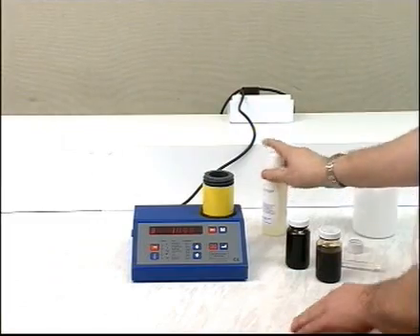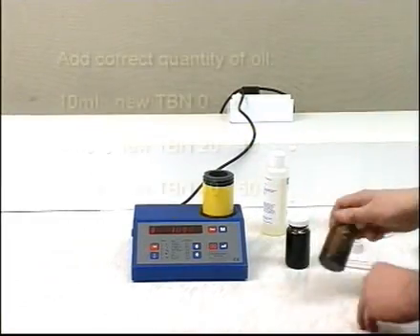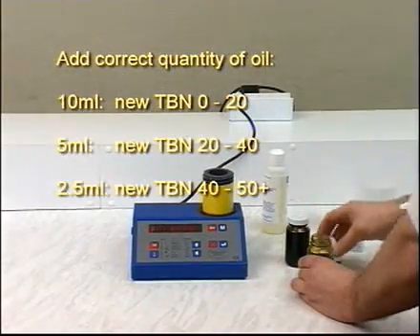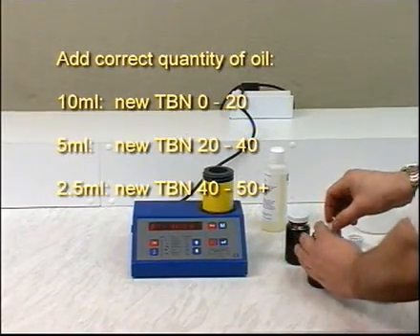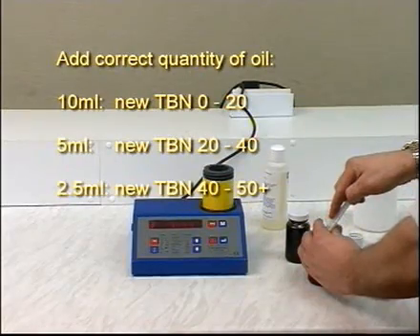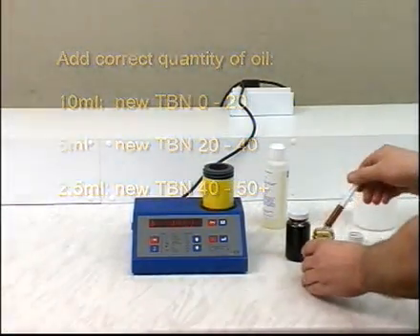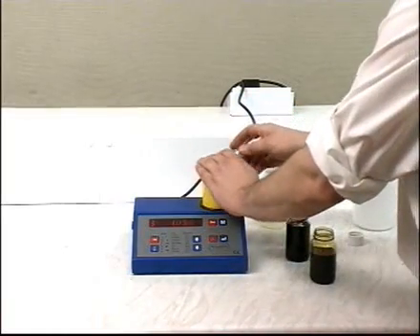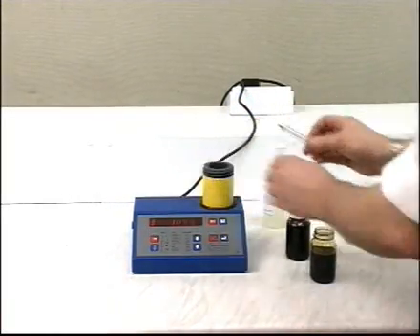Add the correct quantity of oil: 10 milliliters for a TBN of 0 to 20, 5 milliliters for a TBN of 20 to 40, and 2.5 milliliters for a TBN of 40 to 50. Replace and tighten the end cap.